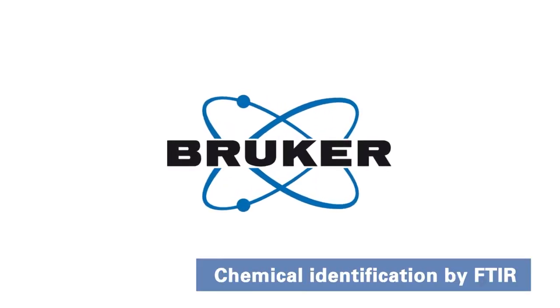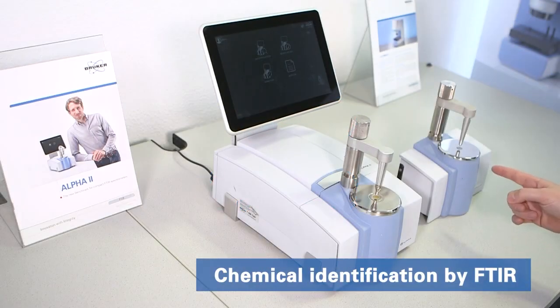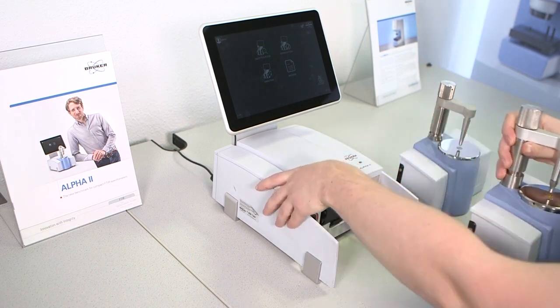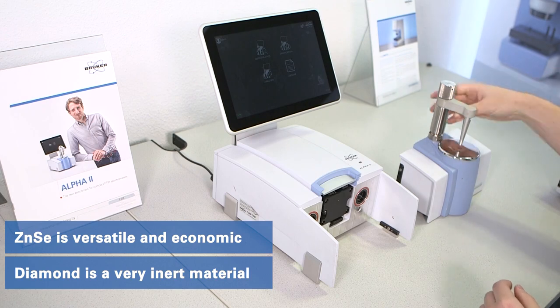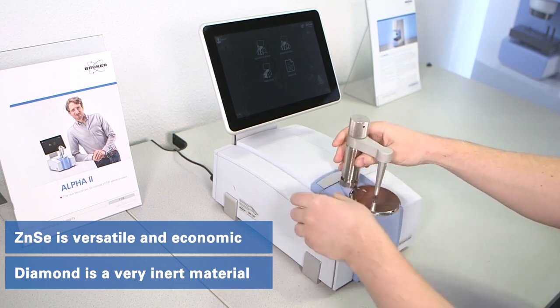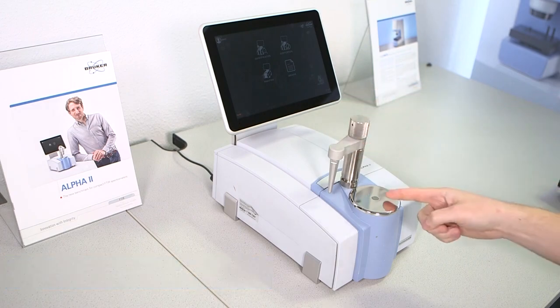This video covers the quick identification of an unknown material by FTIR. For this we change our setup and go from zinc selenide ATR crystal to diamond. While zinc selenide is versatile and economic, diamond crystals are most robust, allowing measurement of almost any sample.